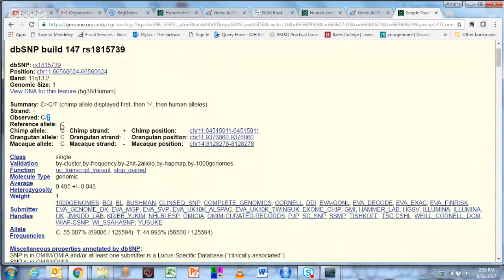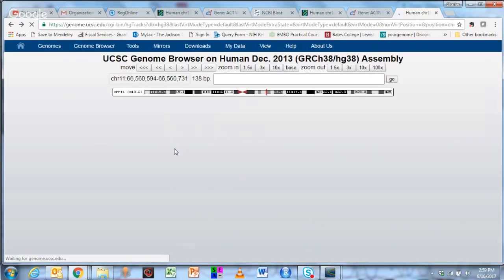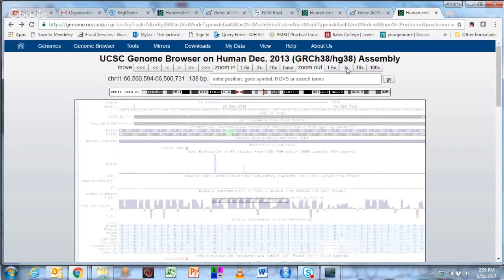is T. The other thing this also gives you is frequency data. So here's the frequency data. 55% of known sequences have a C, with T at 44, and this is how they get the percentages. And so there are 125,000 known sequences of this gene for human, and that's the human variant. Let's go back. So this, I hope, takes a sort of abstract element on a gel, sequences it, and then drills it down to the genome level.